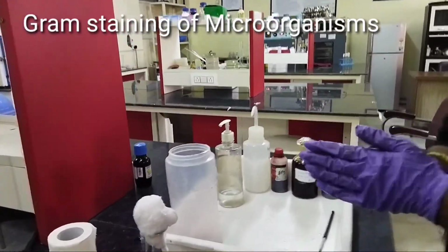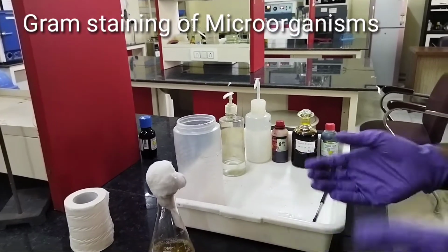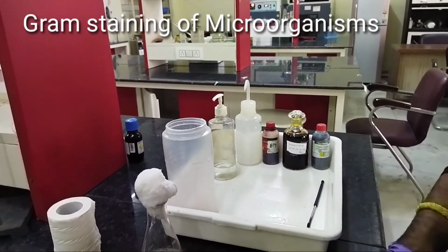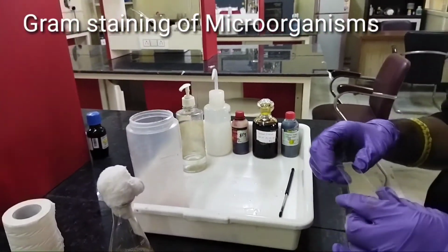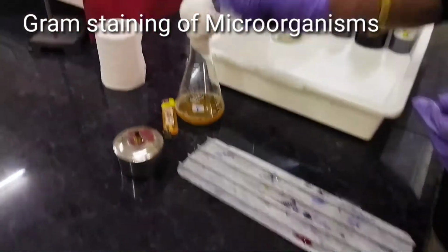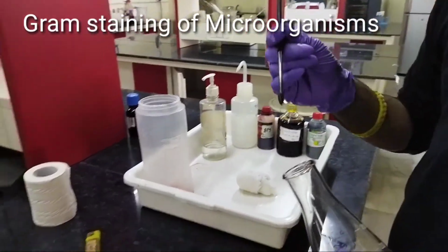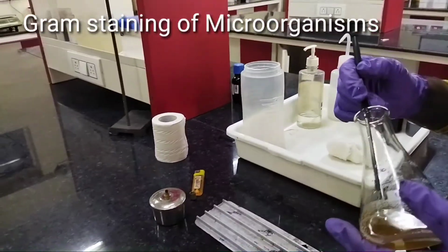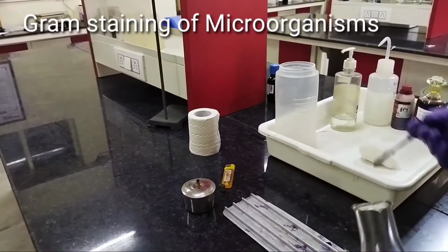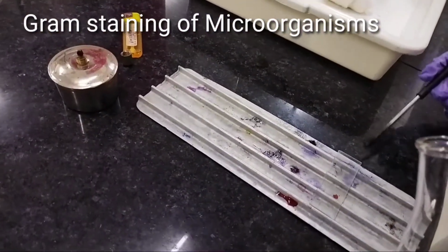So let's start with the simple procedure of gram staining. First of all, we will have to take a clean glass slide, and after that we will put it in a glass holder. We will take bacterial culture using the inoculating loop, and after that we will smear it gently on the glass slide.